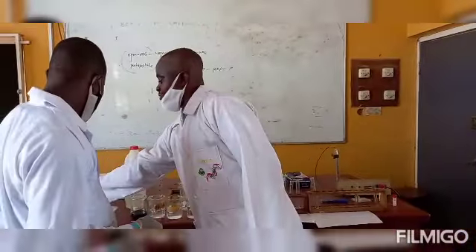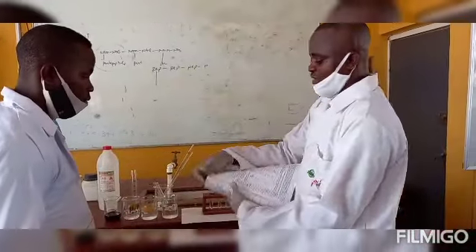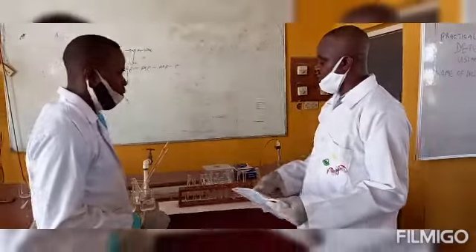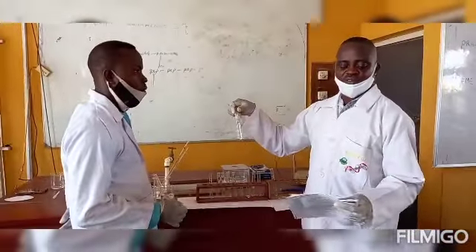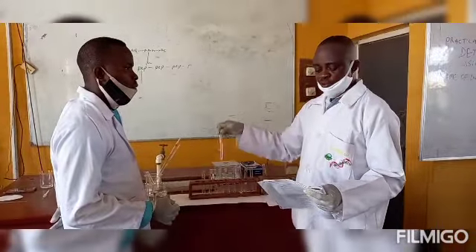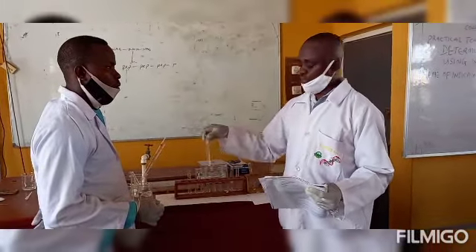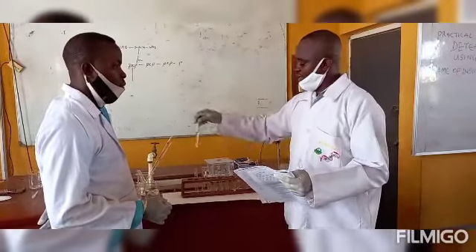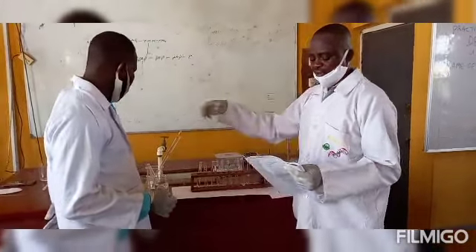If you check your manual, you will see that the first one is 5 ml of potassium dihydrogen phosphate plus 0.56 ml of sodium hydroxide, with 4.44 ml of distilled water added to it. If you add the three together, it will give you 10.